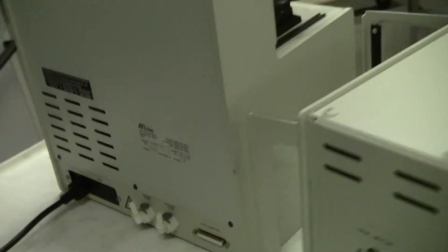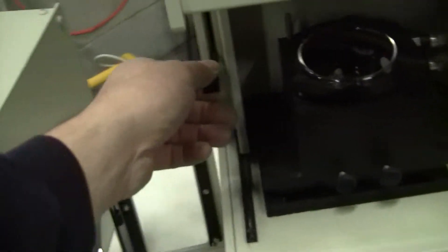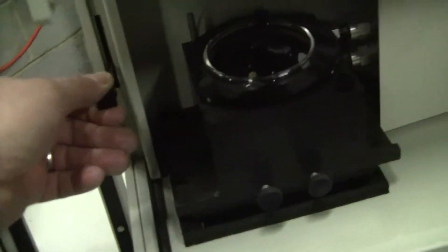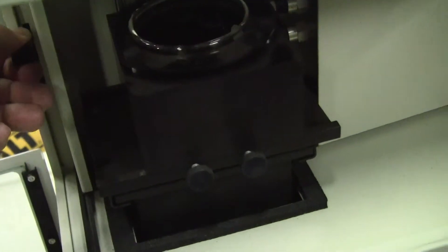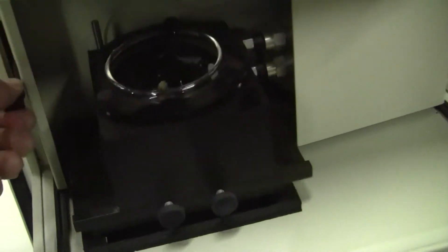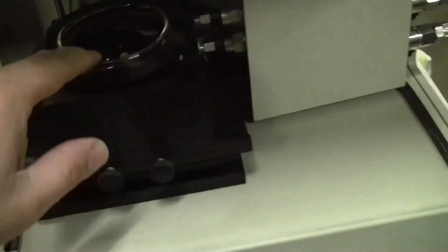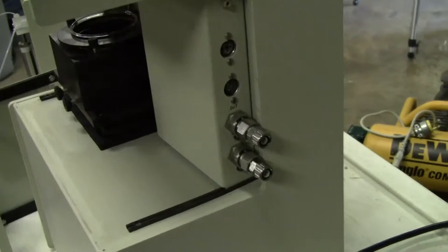Purging samples. This is the sample up and down level. Looks quite nice. Sample holder and container. Heat exchanger for control.